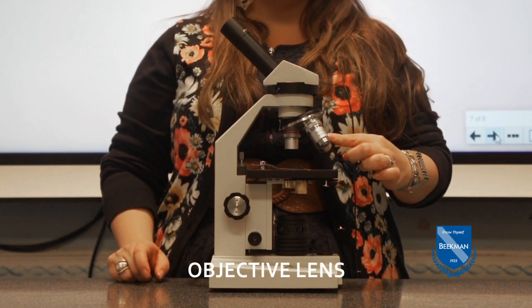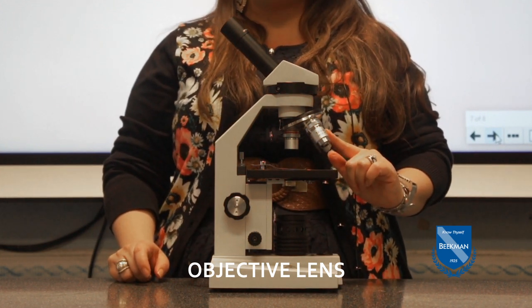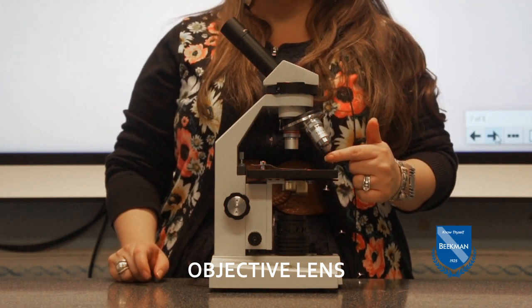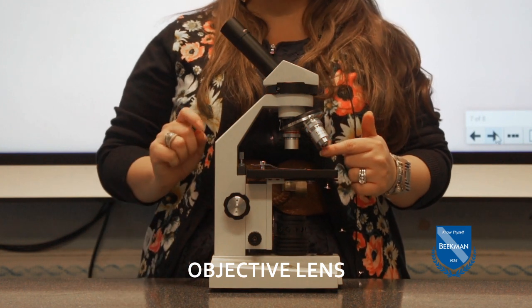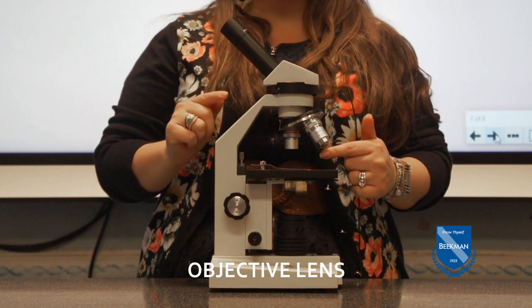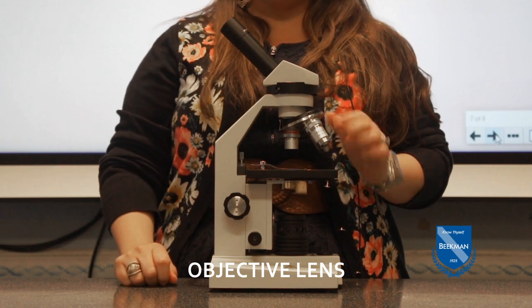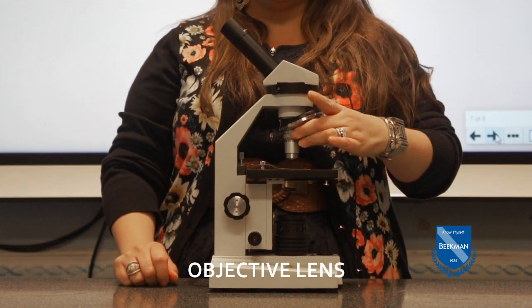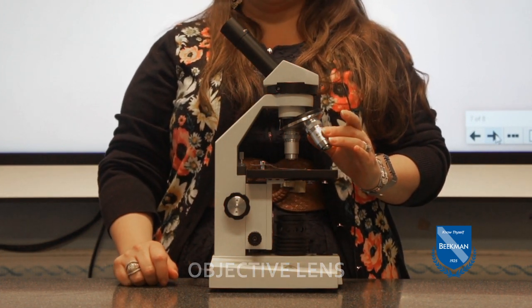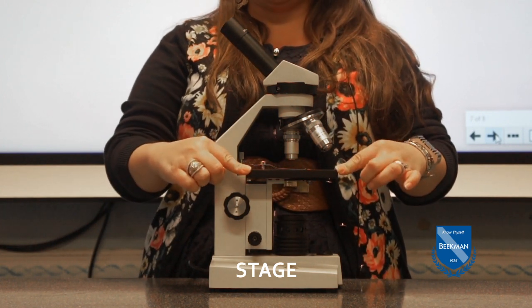So these are the objectives. There is a low, medium, and high objective on this microscope. The low magnification is 4 times. So if you're viewing something under the lowest objective, you have to remember that the ocular lens has a magnification of 10. So you're actually viewing it at 40 times the magnification. Another thing to remember is that each time you change the objective, you are increasing magnification, but you are decreasing the field of view. This is your stage, where you will place your slides and specimens.